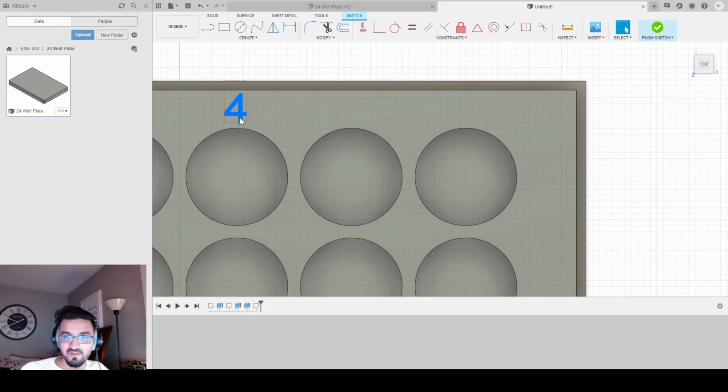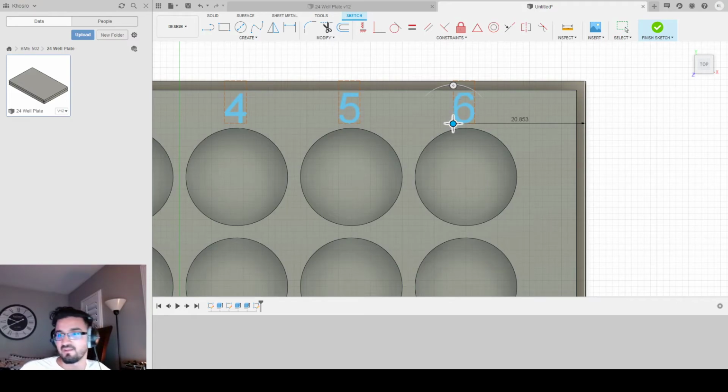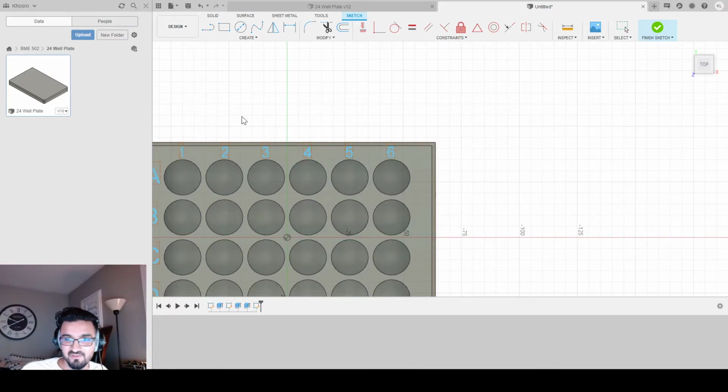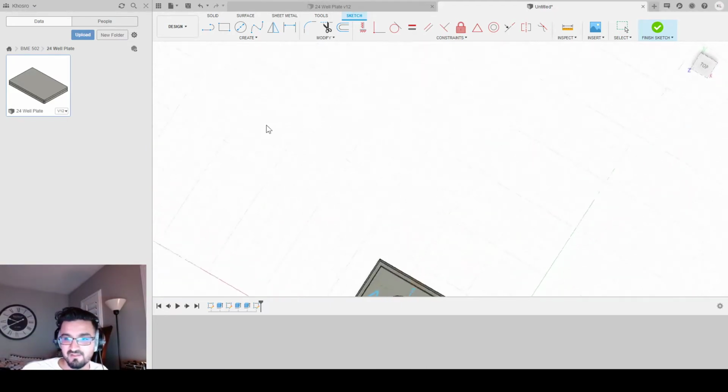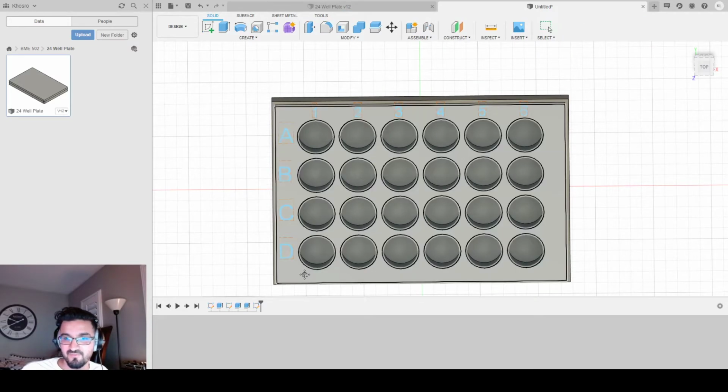Almost there, just 2 more. Copy, paste, go over another 18. Okay, change this to a 5. Copy, paste, move this over, another 18. Change this to a 6. And now we have our letters and numbers. Yay. Look at that. Letters and numbers. We're finished with the sketch.